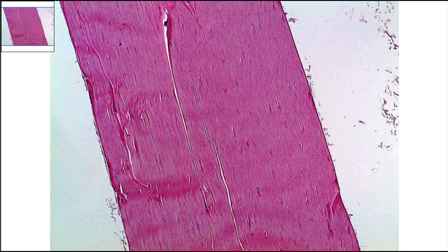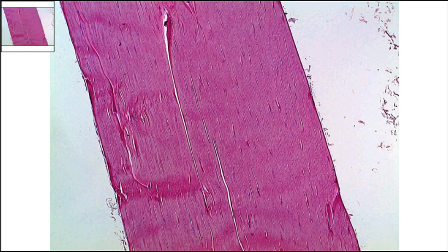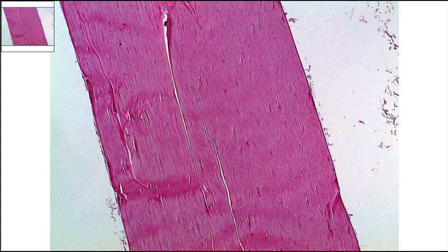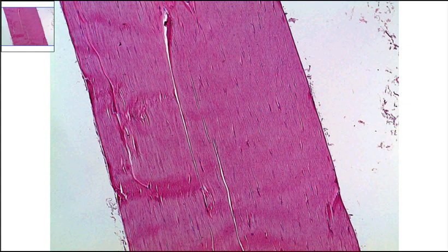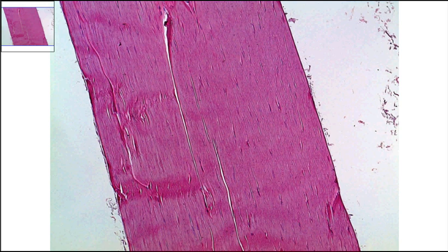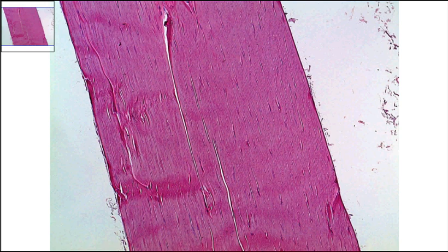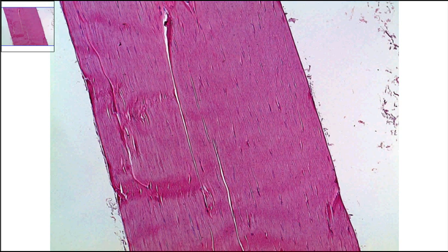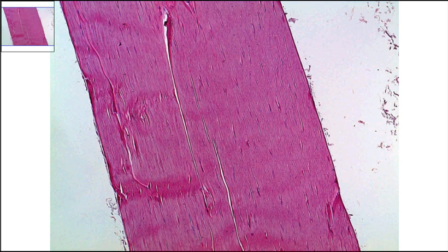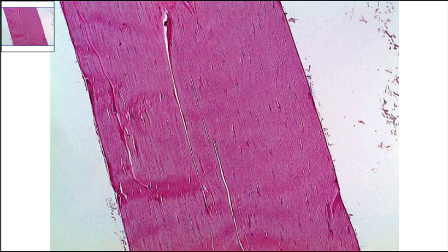This slide is dense regular connective tissue at 100x total magnification. We're looking for the main components of connective tissue and what makes this dense regular. It's important to distinguish this from dense irregular, as there is also a slide for that tissue type.